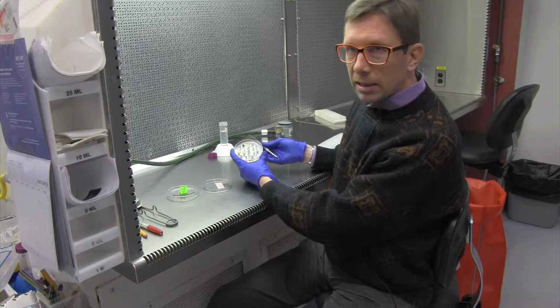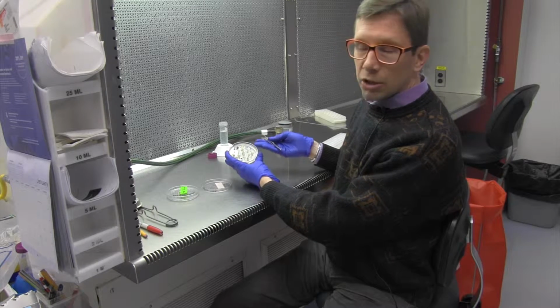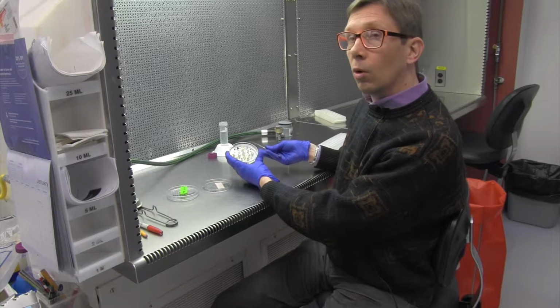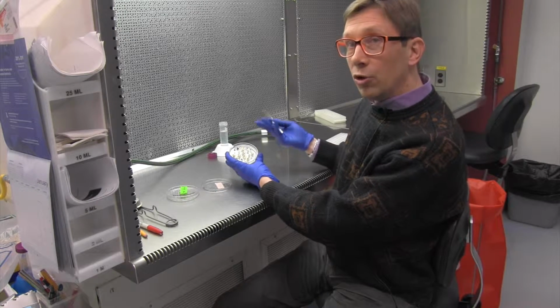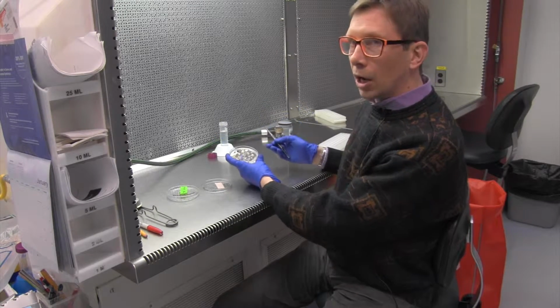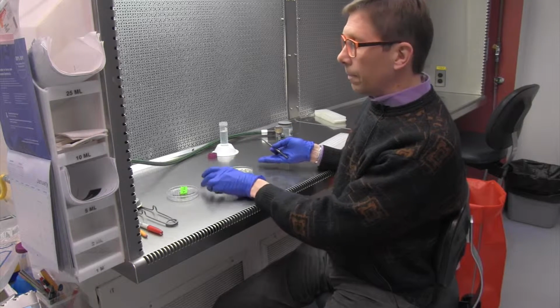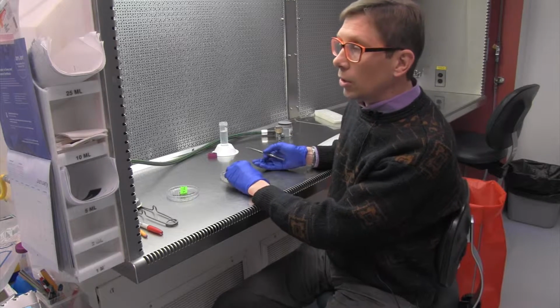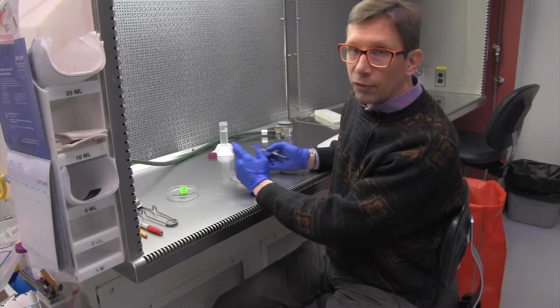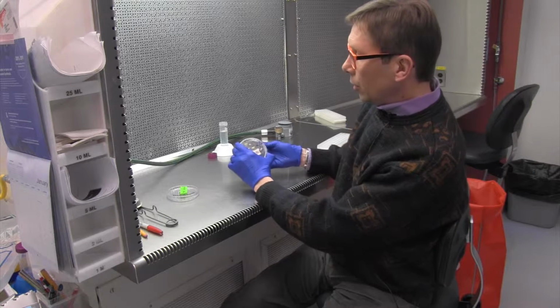This isn't always necessary for every variety of cacao, but as I just mentioned before, some varieties cannot self-pollinate, and so this is the only way that you could propagate a clone or something that has those characteristics that you wish. Usually the best chance that you have to propagate them is from using the petals of the flower. When they get bigger, you can see the different stages.